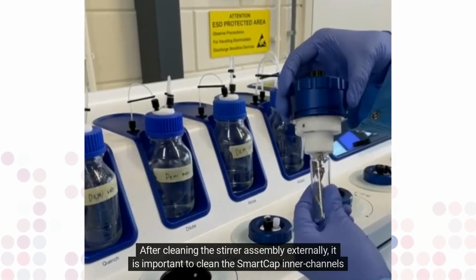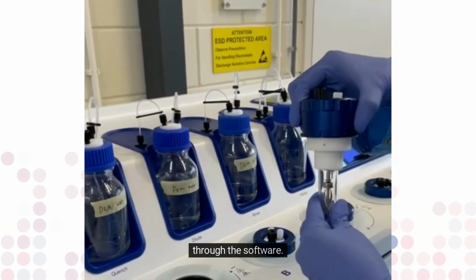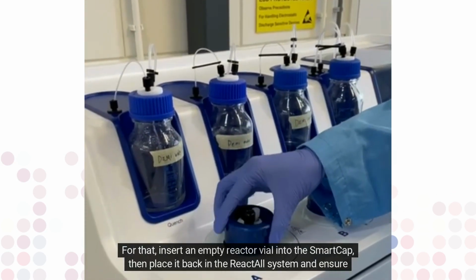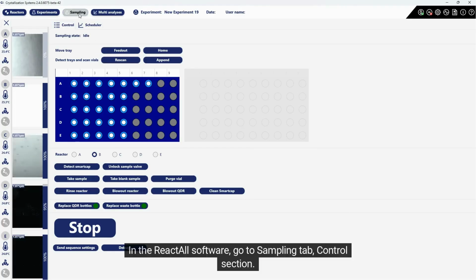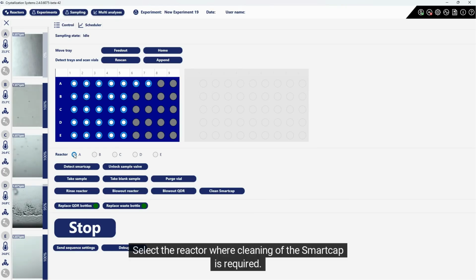After cleaning the stirrer assembly externally, it is important to clean the SmartCap inner channels through the software. For that, insert an empty reactor vial into the SmartCap, then place it back in the ReactALL system and ensure it is properly closed. In the ReactALL software, go to Sampling tab, Control section. Select the reactor where cleaning of the SmartCap is required.